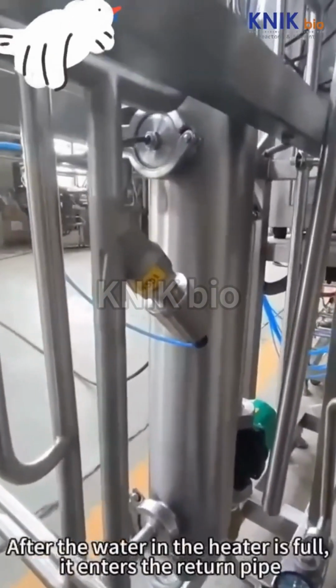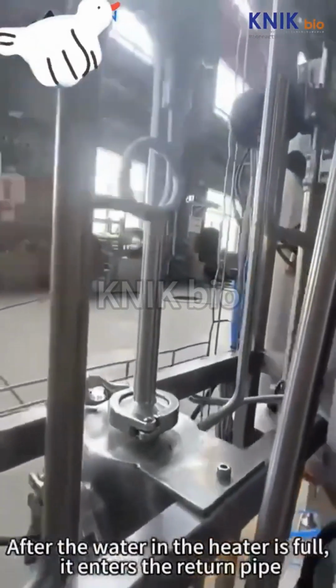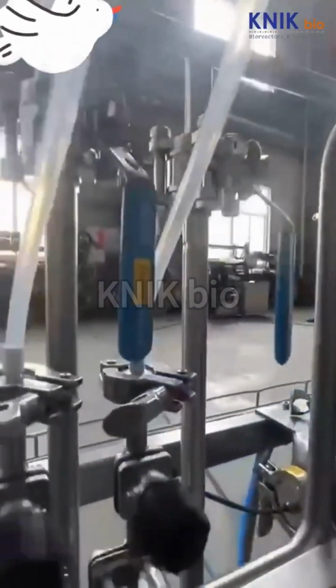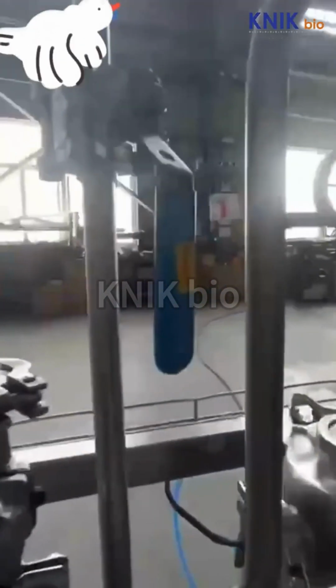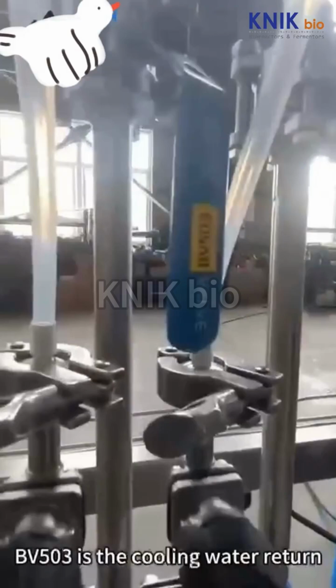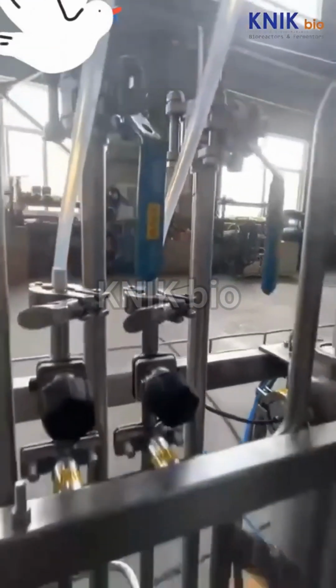After the water in the heater is full, it enters the return pipe. BV504 is the chilled water return. BV503 is the cooling water return.